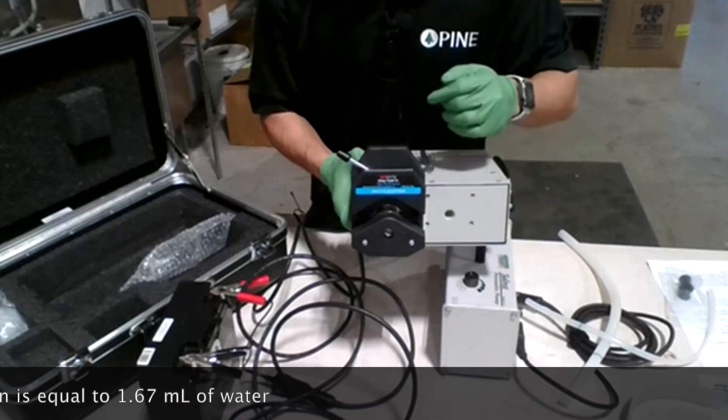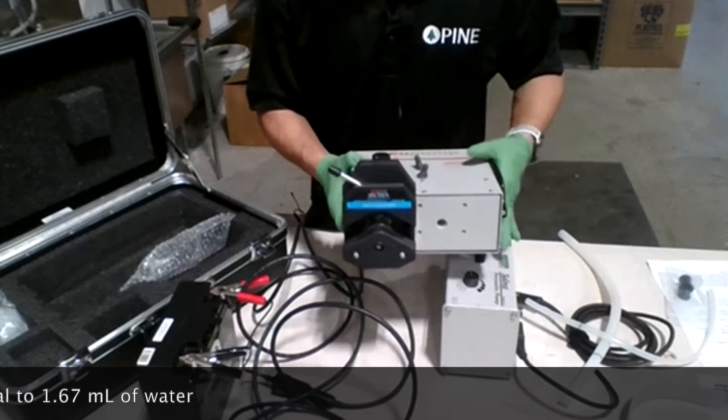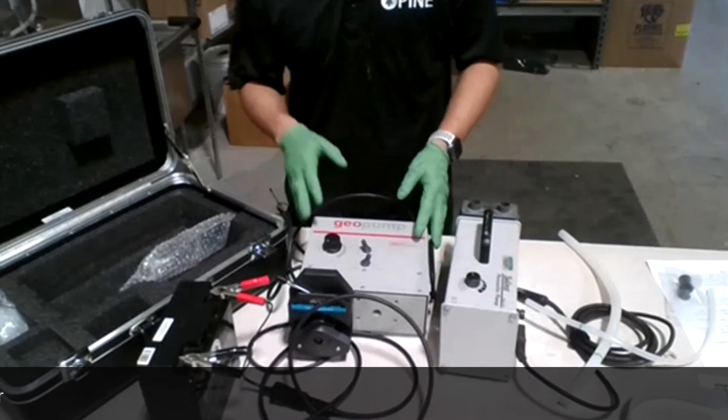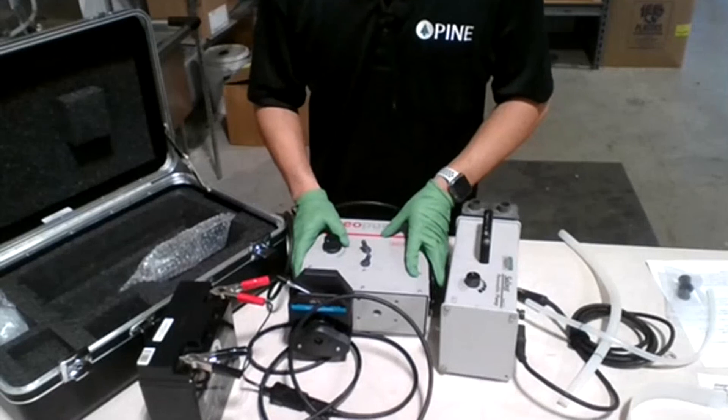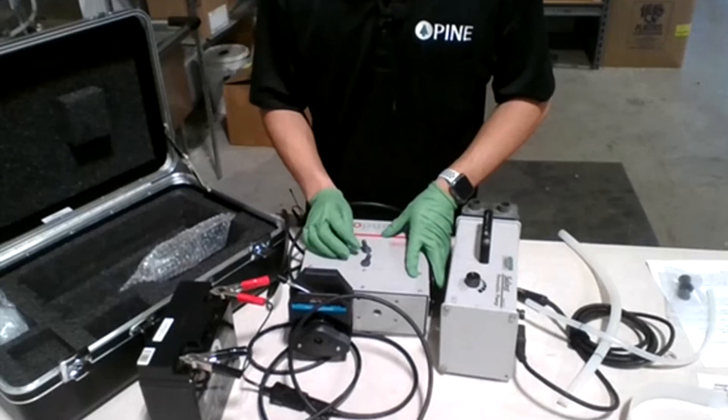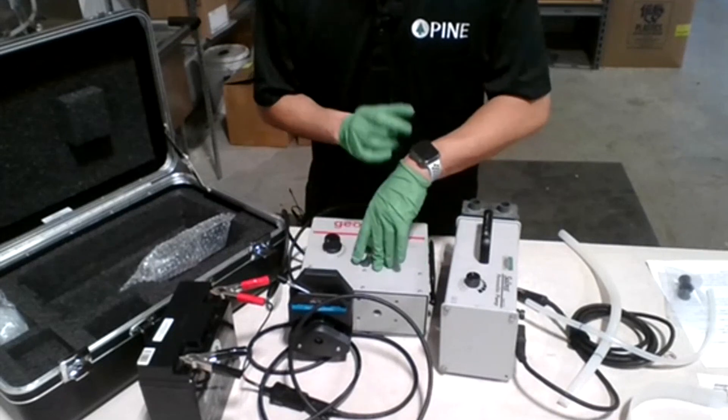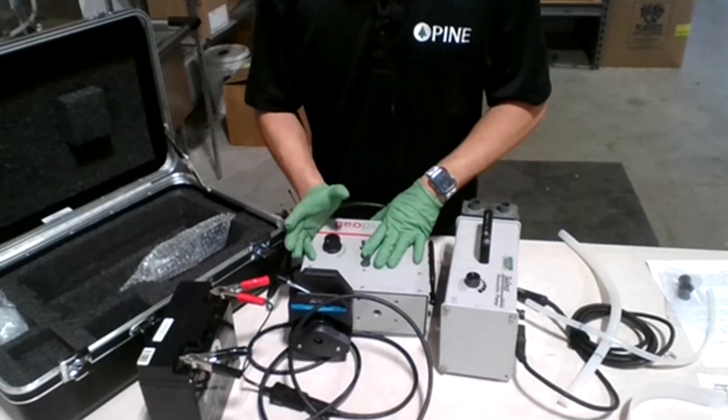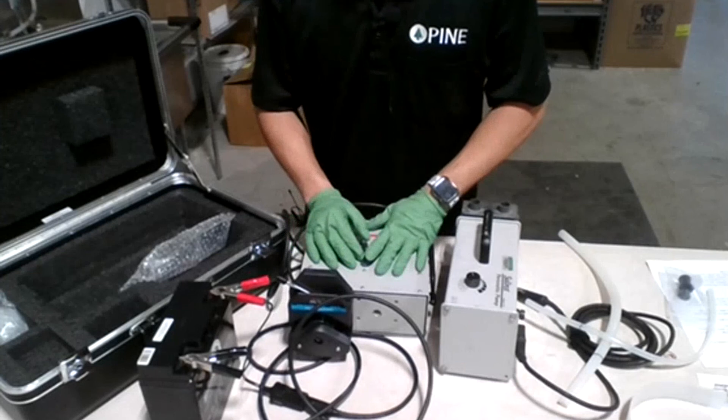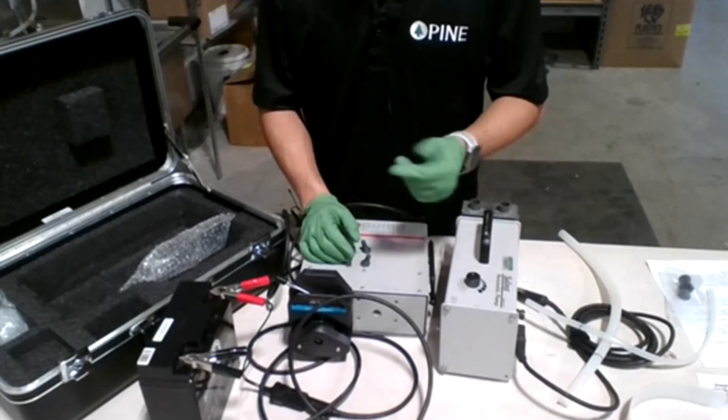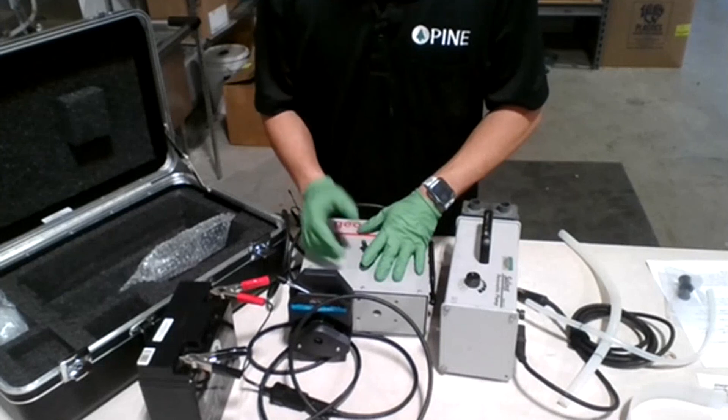If you're counting too fast and can't keep up with the counting, you can simply get a stopwatch and use something with volume, like the bucket that Matt was showing you. It has grading so you can see - if you have 20 liters in the bucket in one minute, that means your flow rate is 20 liters per minute, and so forth.